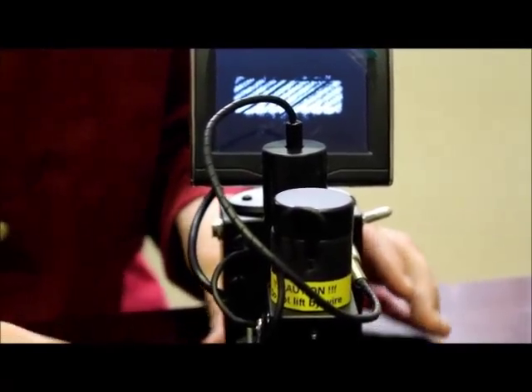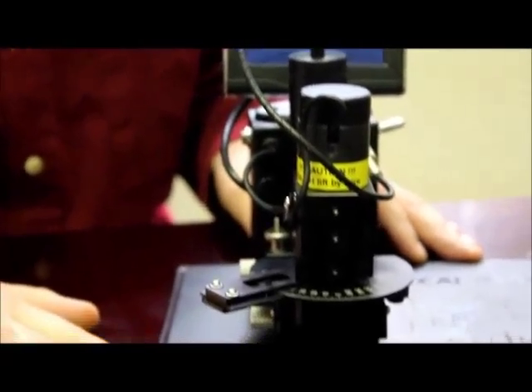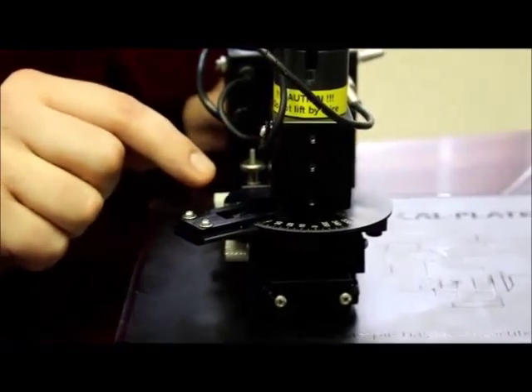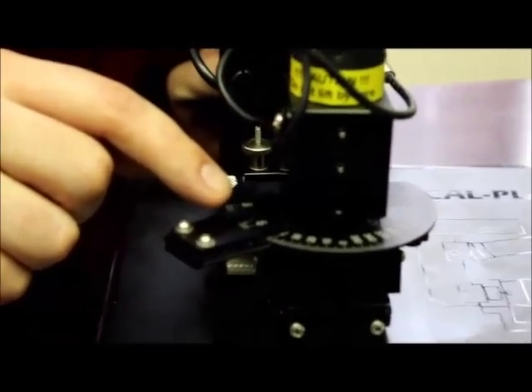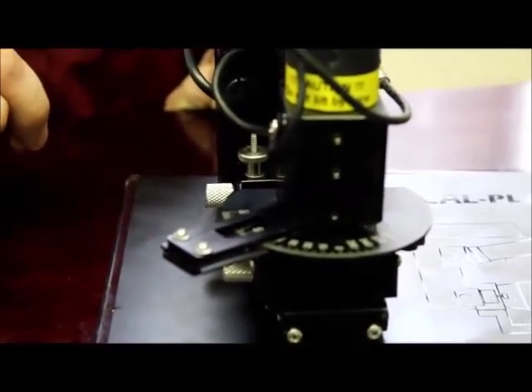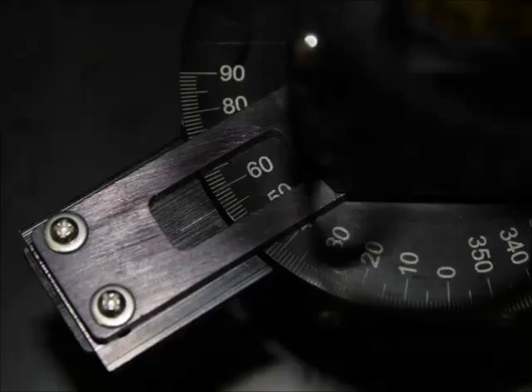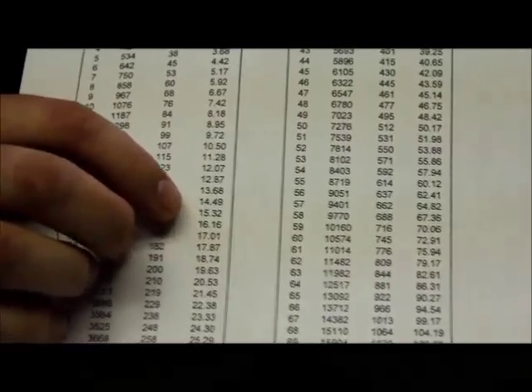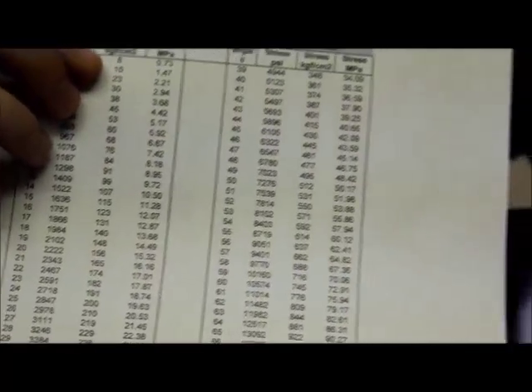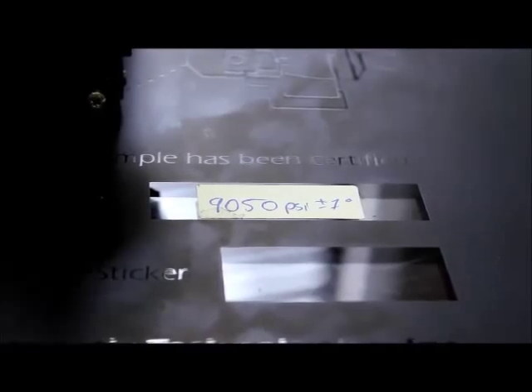Once we've done that, we want to check the protractor dial and see where the measurement ended up. In this case, it was approximately 56 degrees on the protractor dial. We want to compare that value to the value that is on the cal plate. In this case it's 9,050 psi, and that's plus or minus one degree. So we consider the instrument to be measuring well and accurate if we are plus or minus one degree of that measurement. In this case we are.